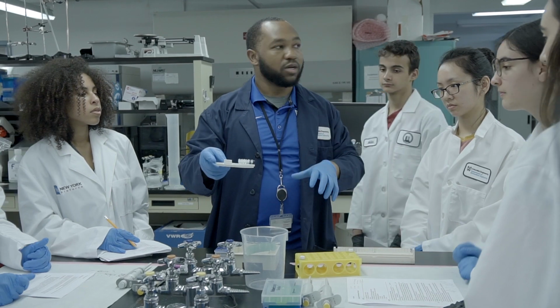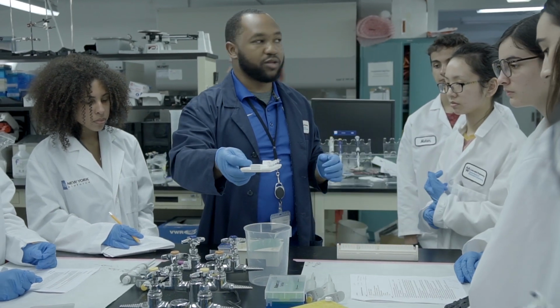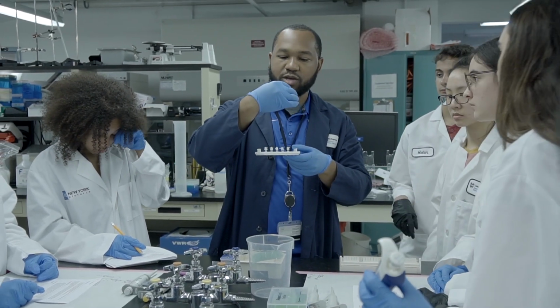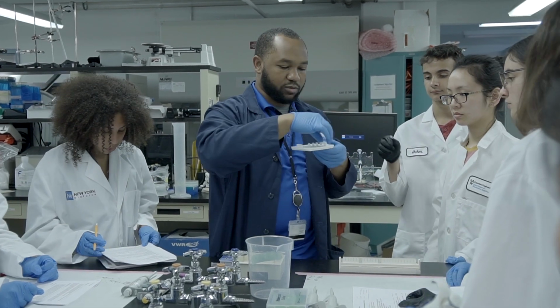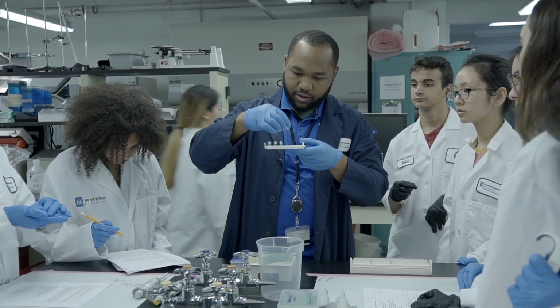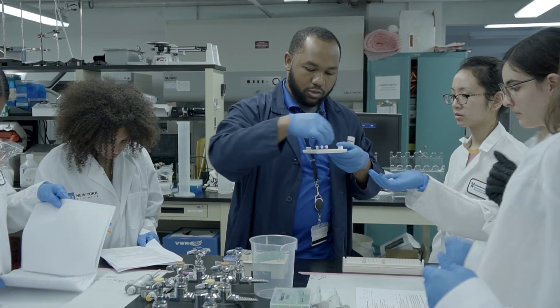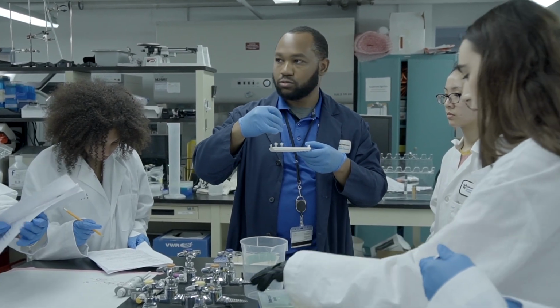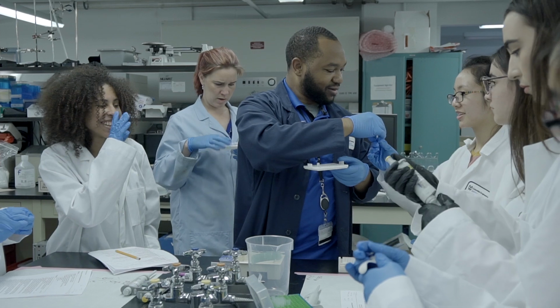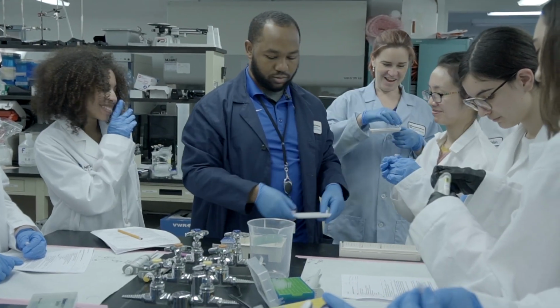So everyone's restriction digest should be here. You're going to be adding 10 microliters of the buffer. There are 2 vials of it here. And you're adding 10 to your sample. Who's YA1? Perfect. Everybody got one? YA1 PCR.